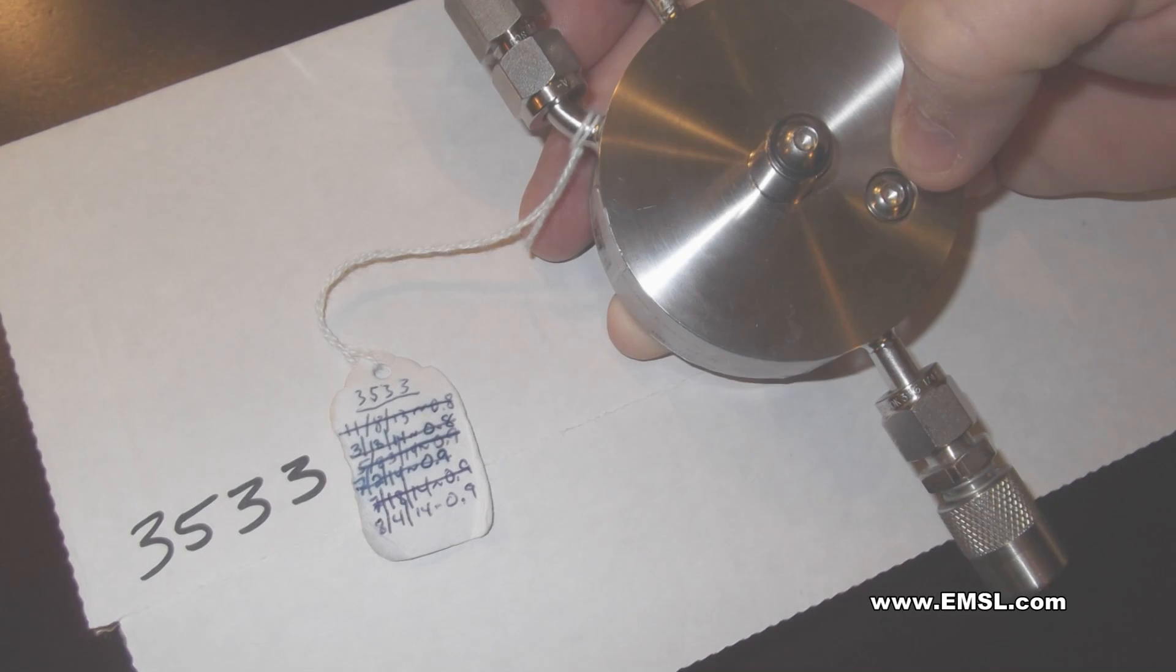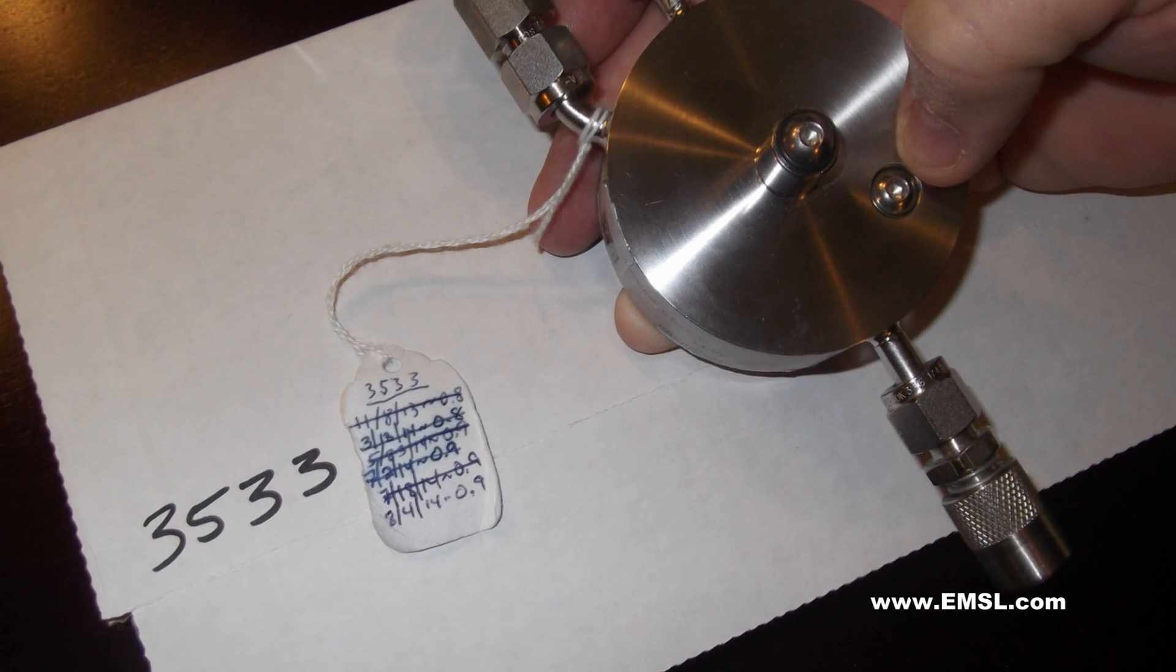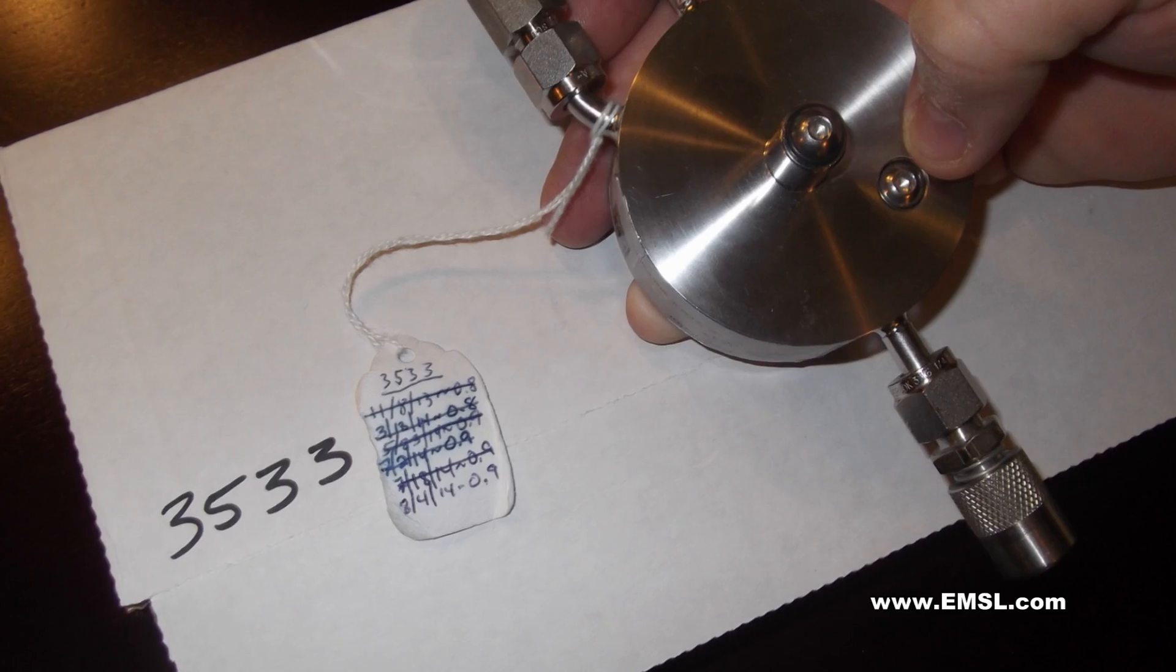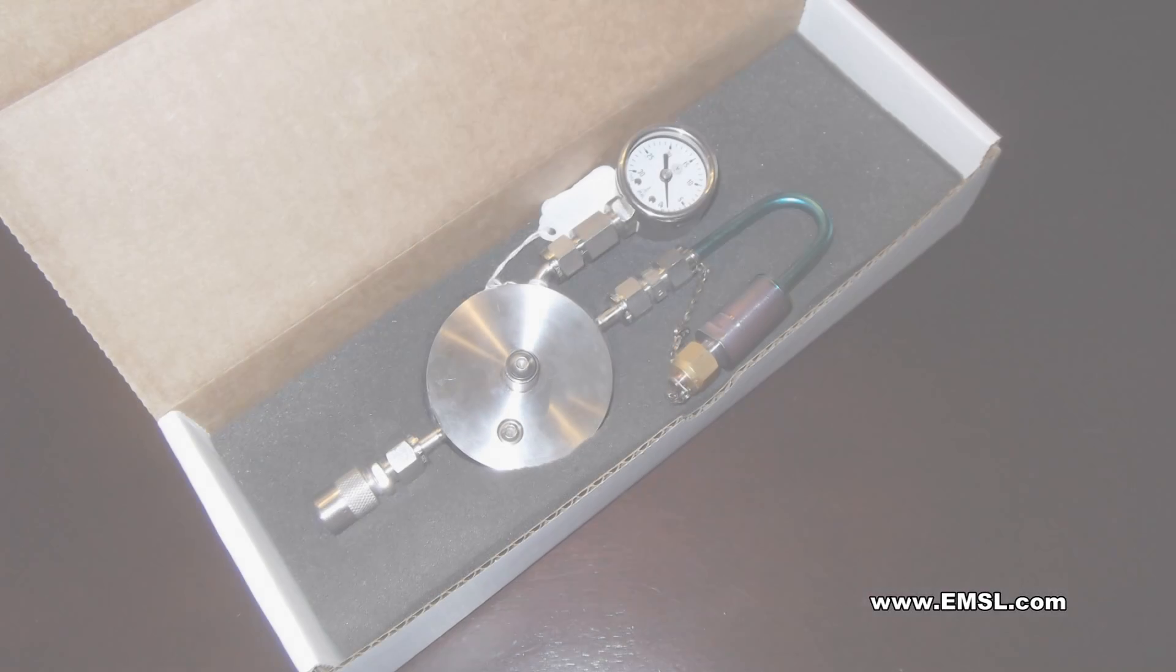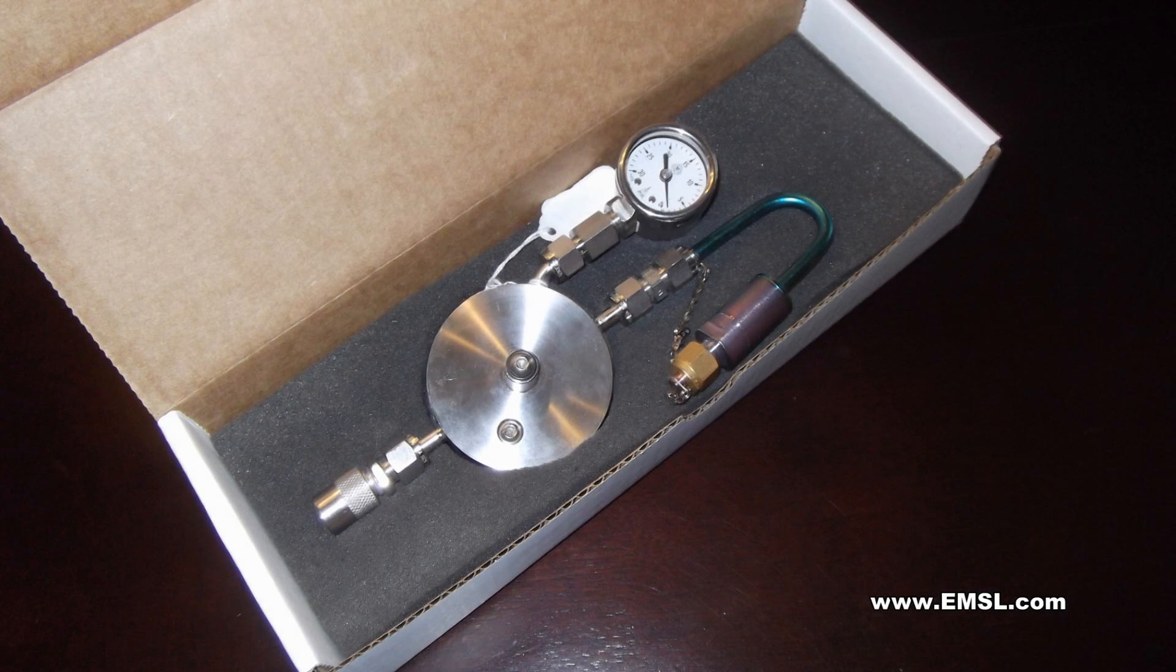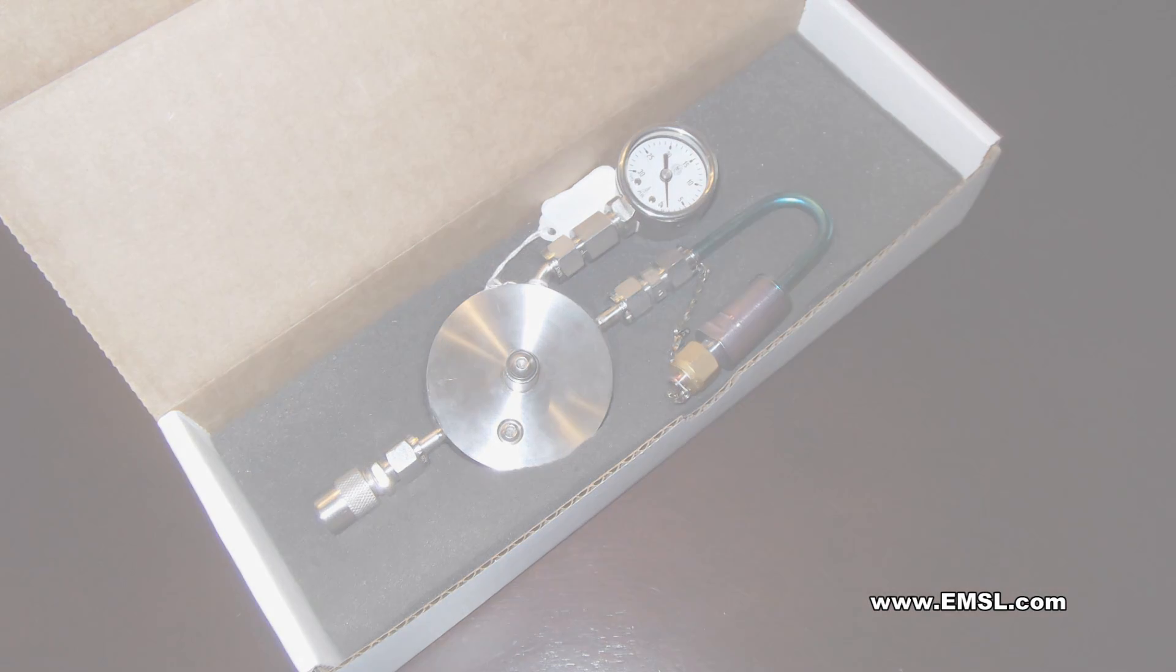When placing the regulator back into the shipping box, be sure the regulator number matches the serial number on the box. Please do not mark on the regulator box. There are tags on your cans for notes. Replacement costs of boxes will be charged.